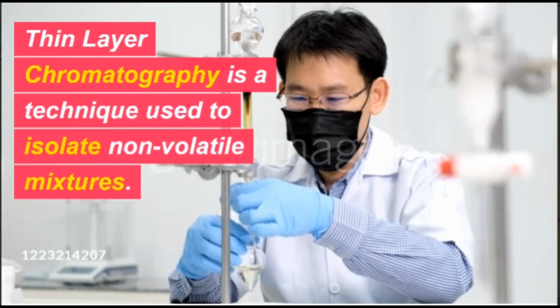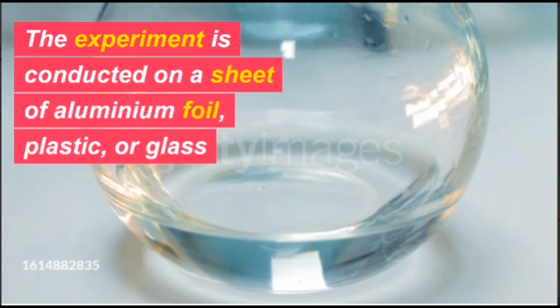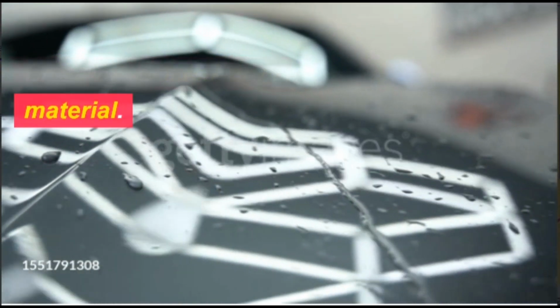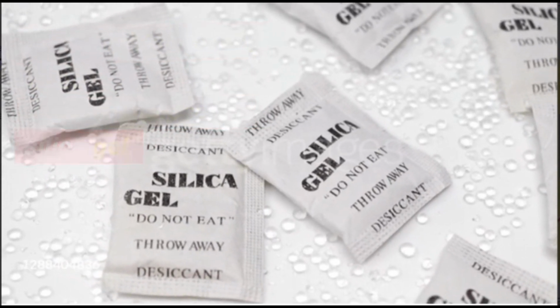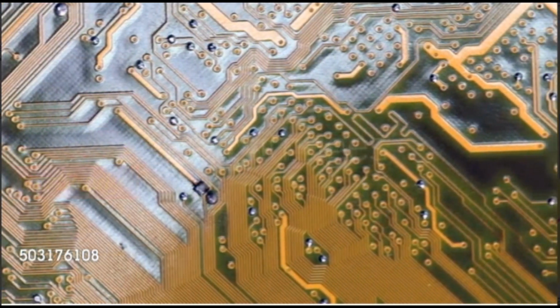Thin layer chromatography is a technique used to isolate non-volatile mixtures. The experiment is conducted on a sheet of aluminium foil, plastic, or glass, which is coated with a thin layer of adsorbent material. The material usually used is aluminium oxide, cellulose, or silica gel. On completion of the separation, each component appears as spots separated vertically.